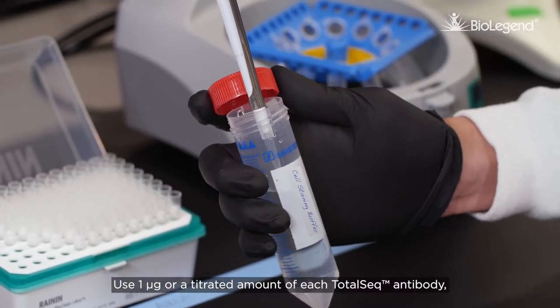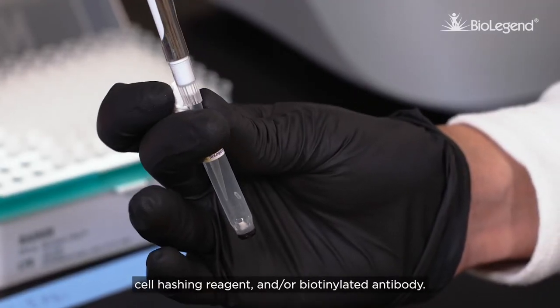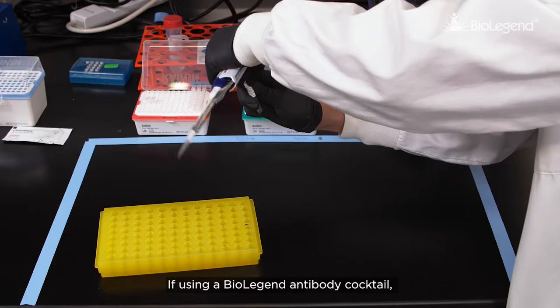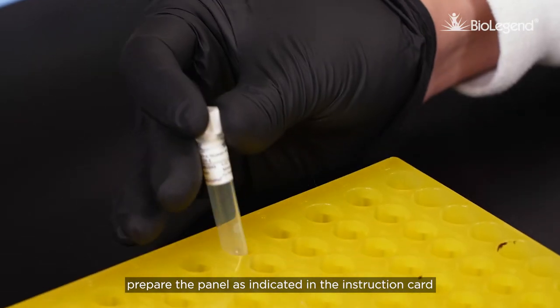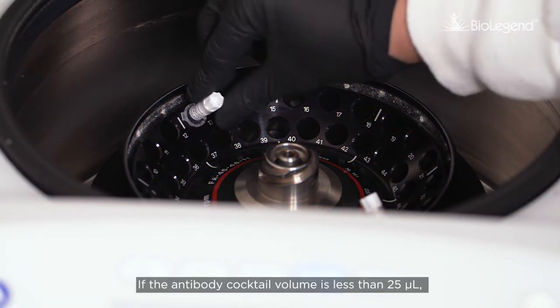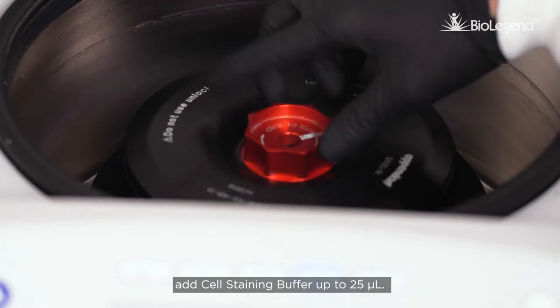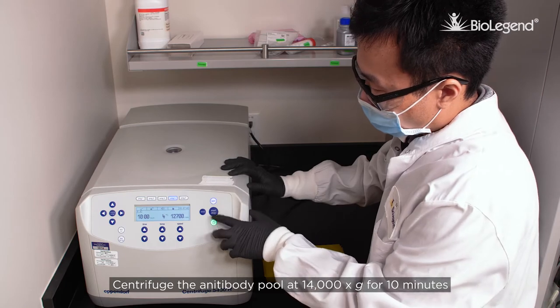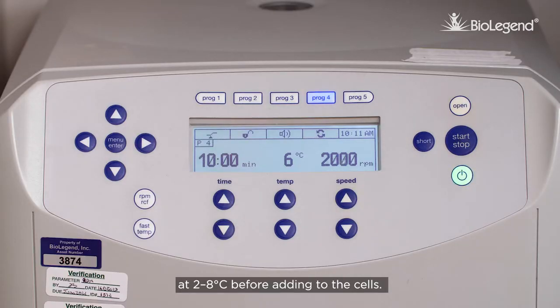Use 1 microgram or a titrated amount of each TotalSeq antibody, cell hashing reagent, and/or biotinylated antibody. If using a BioLegend antibody cocktail, prepare the panel as indicated in the instructions card included with your product. If the antibody cocktail volume is less than 25 microliters, add cell staining buffer up to 25 microliters. Centrifuge the antibody pool at 14,000 G for 10 minutes at 2 to 8 degrees Celsius before adding to the cells.